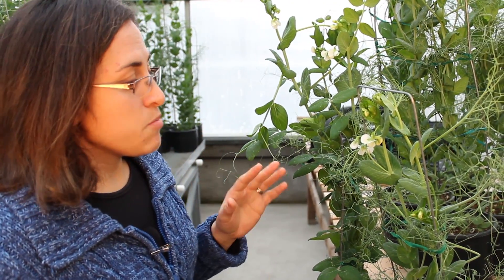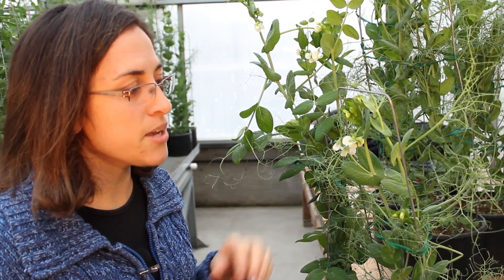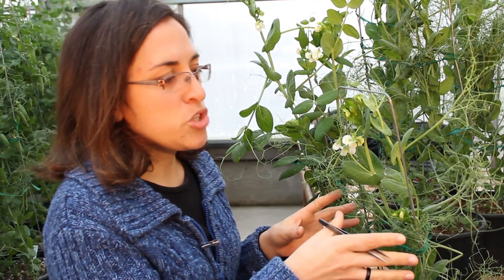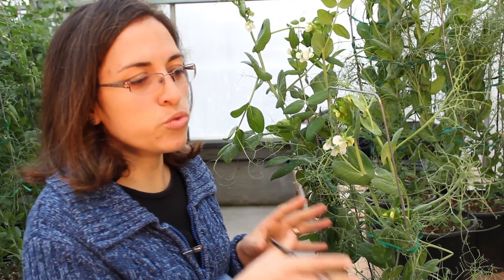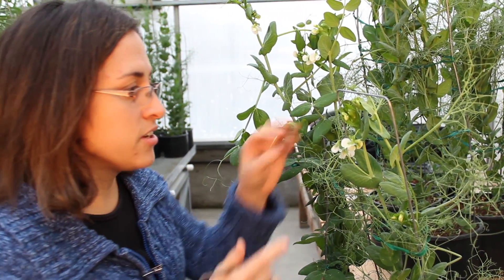It's important to remember that peas, like other plants, are self-pollinated, which means they have male and female flowers on the same plant. So the female I'm choosing — I have to remove the male parts of it.